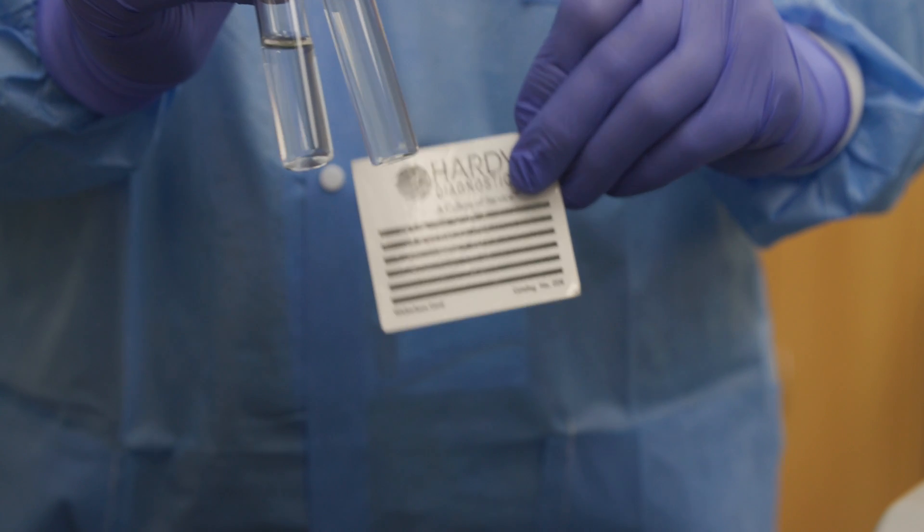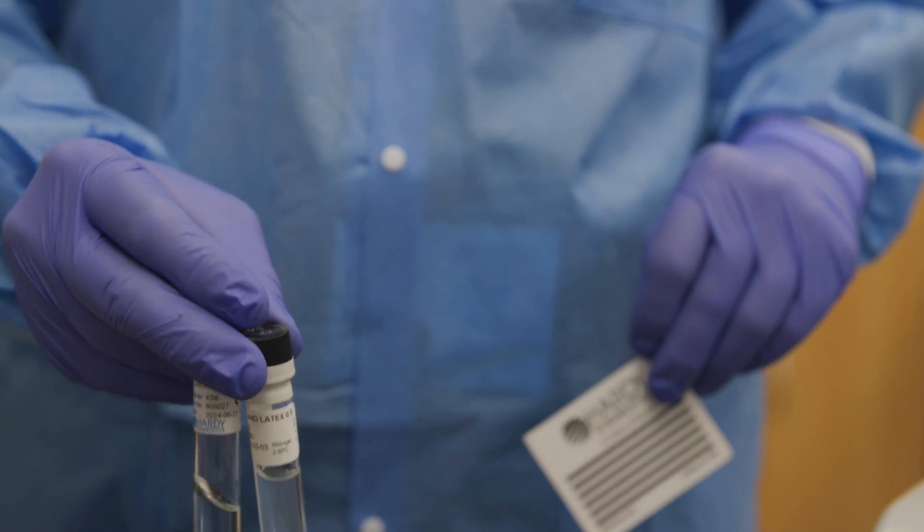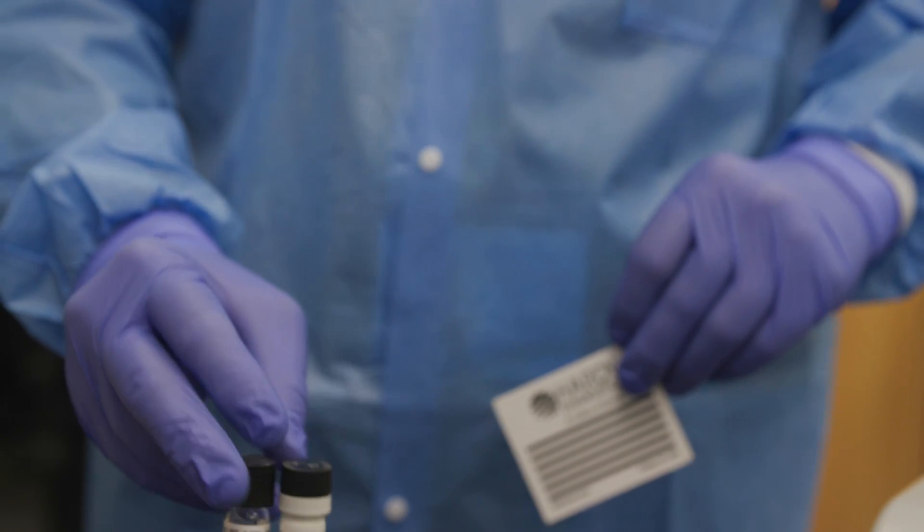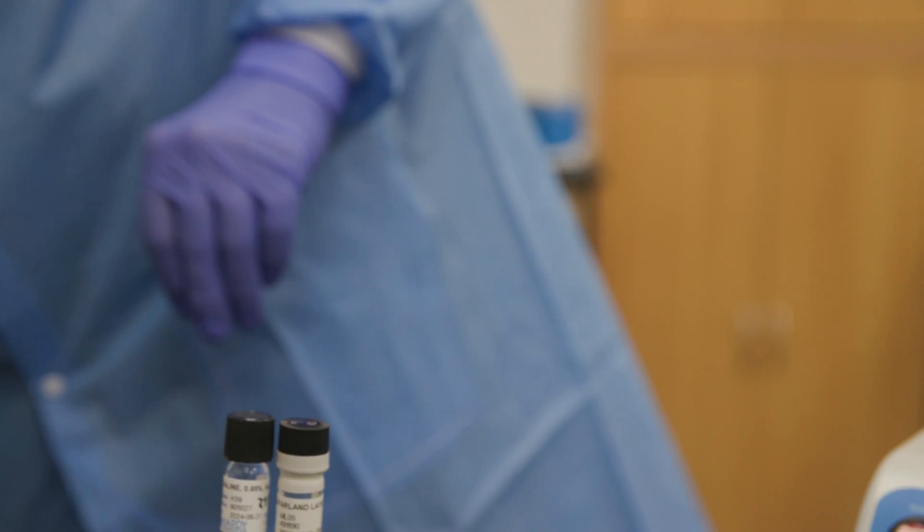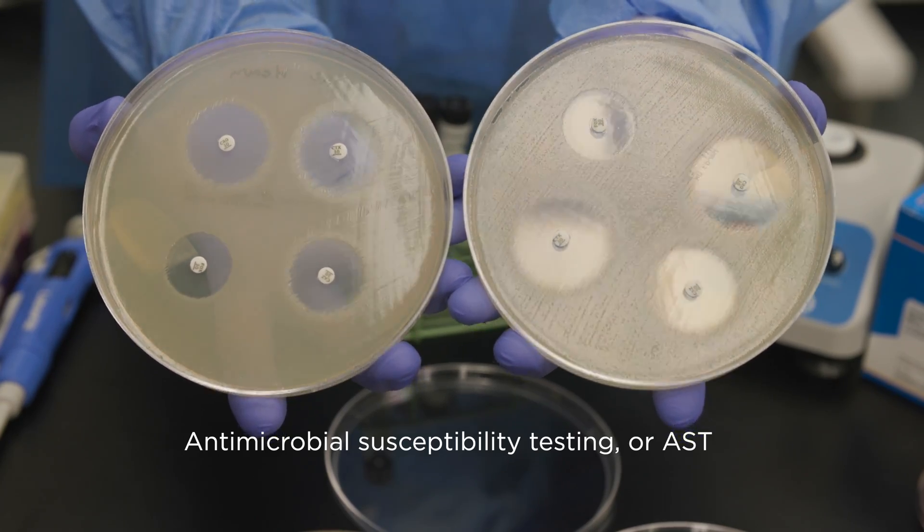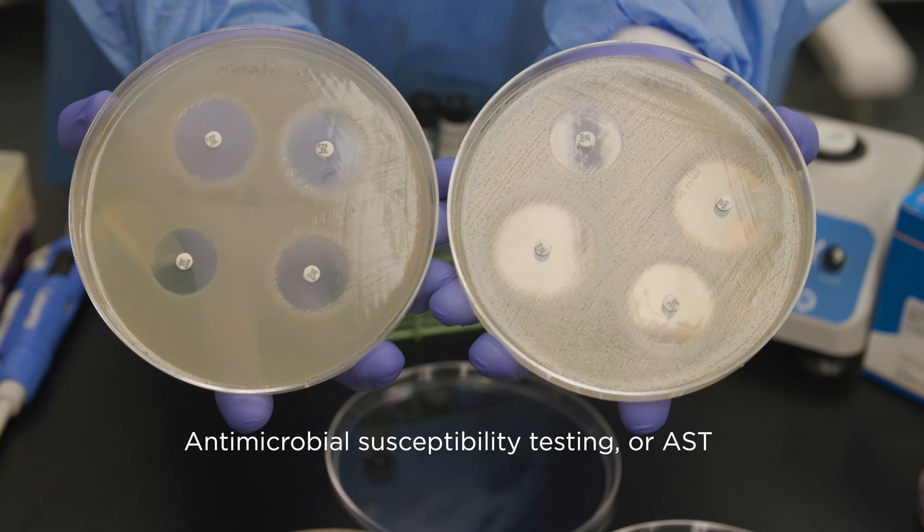Adjusting the turbidity appropriately is important, as a too high or too low concentration may lead to false resistant or false susceptible results when performing antimicrobial susceptibility testing or AST.